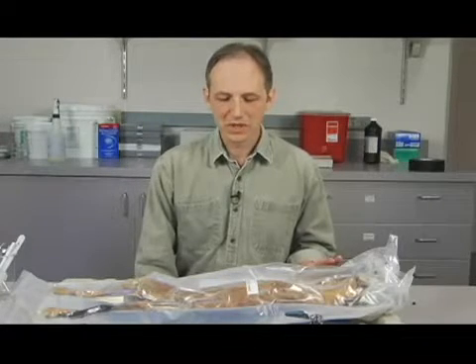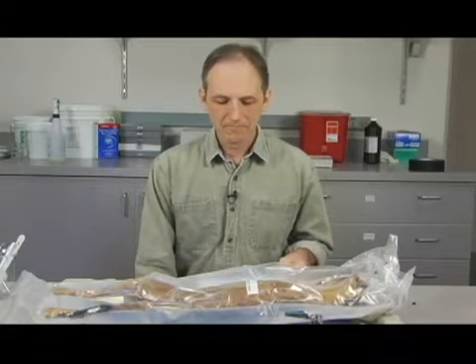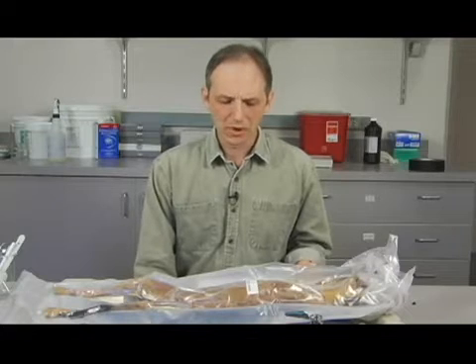The purpose of the demonstration I'm going to give you today is to help people become more comfortable and more familiar with the specimens that we're going to be using and the procedures for the class. This can be a difficult area for some people, I realize that, and I thought it might help to show you around a little bit here to get you more familiar with the materials and the specimens that we use. I think the hardest part is just feeling comfortable having seen the materials, specifically having seen the specimens. And if you can do that through this video, then when you come to class, I think you'll feel a lot more at ease and comfortable with what we're about to do.